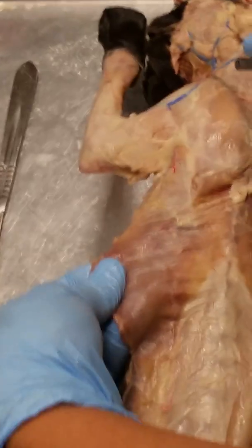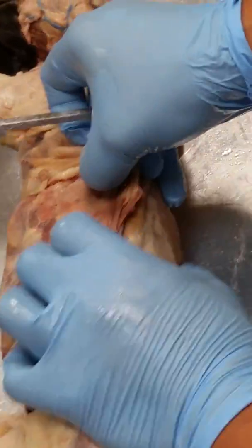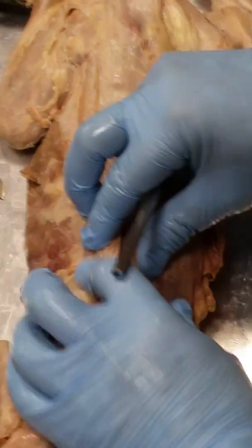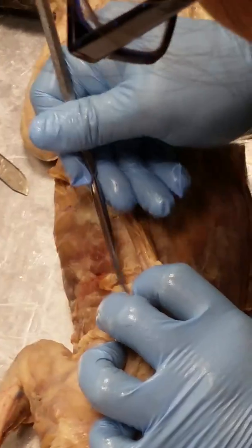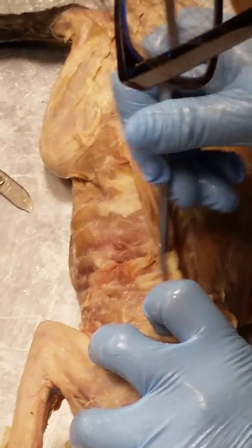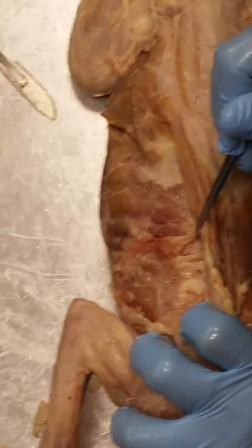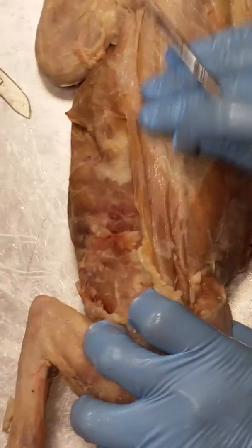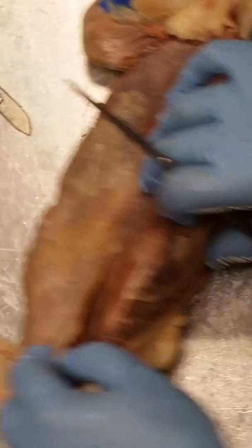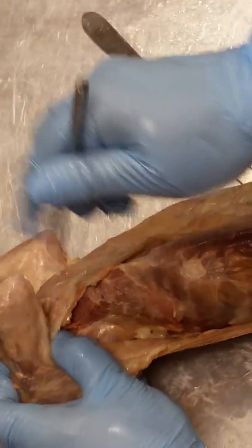Okay. So here is the latissimus dorsi. Okay? So if I peel up the latissimus dorsi all the way, I encounter all this fat. So I'm going to do it. I already did it over here. But underneath the fat is all of this jagged-edged muscle right in here. Okay? This is the serratus dorsalis. Okay, so it's way up here, serratus dorsalis. The serratus ventralis is right here on the ventral side.